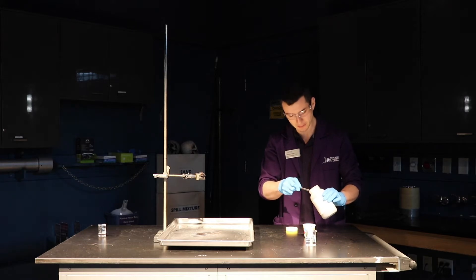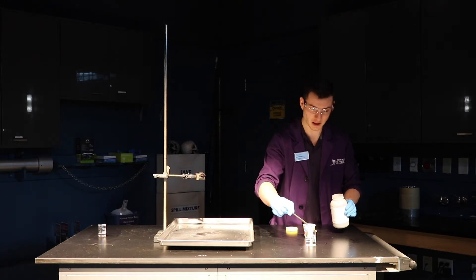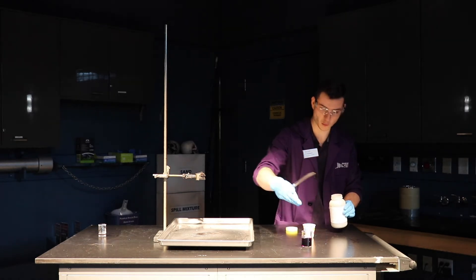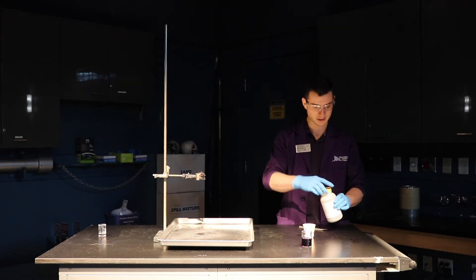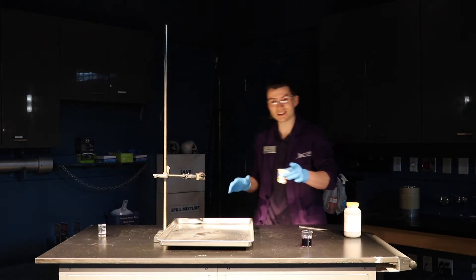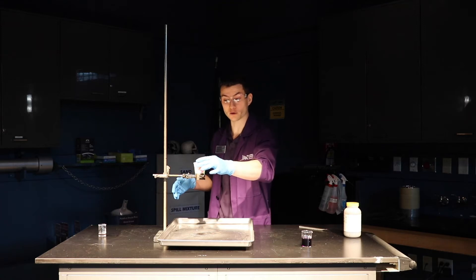Now it's not called the Purple Cow experiment because of the color of our lab coats, but rather see what happens when our potassium permanganate mixes with water here. So we have our potassium permanganate, which is a strong oxidizing agent. Basically, it helps things burn and burn quickly.